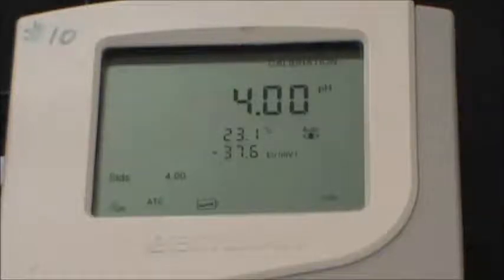You will know that the reading has stabilized when the eye icon below the pH has stopped flashing and the correct value of the buffer solution is shown on the screen.